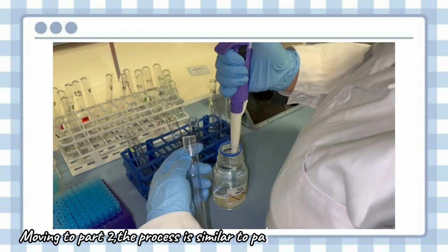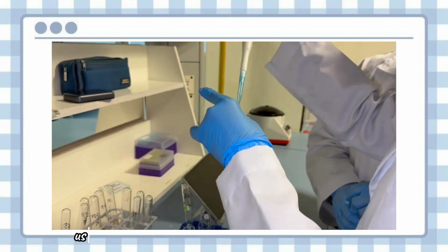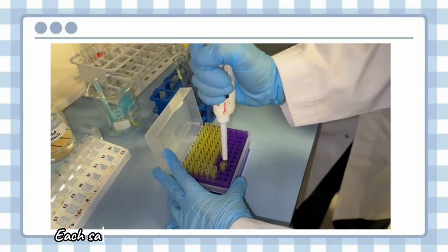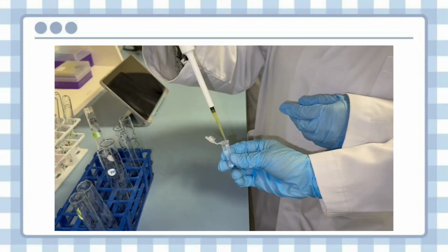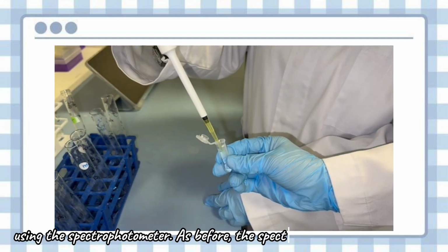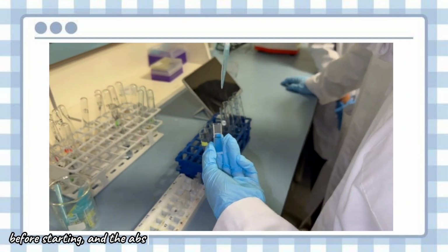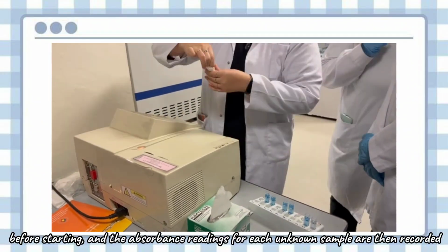Moving to part 2. The process is similar to part 1, except this time we'll be using the unknown protein standard solutions A, B, and C. Each sample will be measured for its absorbance at 595 nanometer using the spectrophotometer. As before, the spectrophotometer is blanked before starting, and the absorbance readings for each unknown sample are then recorded.